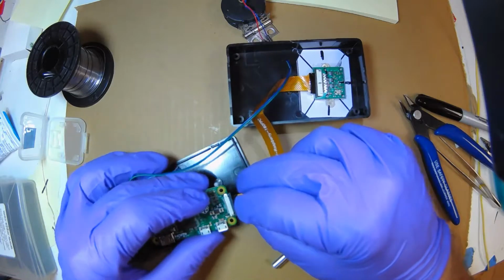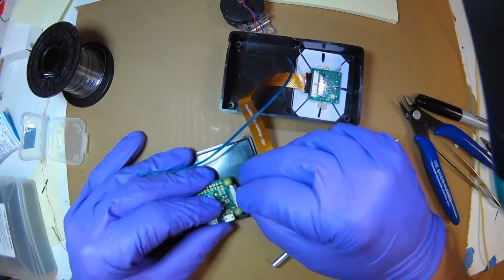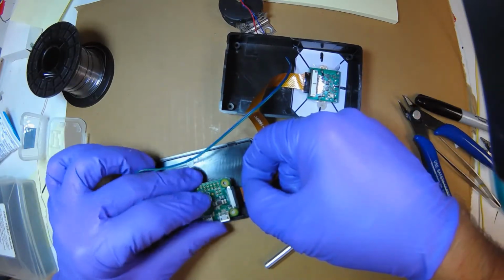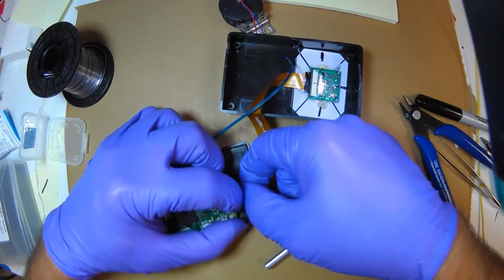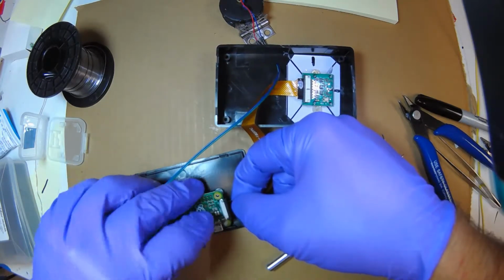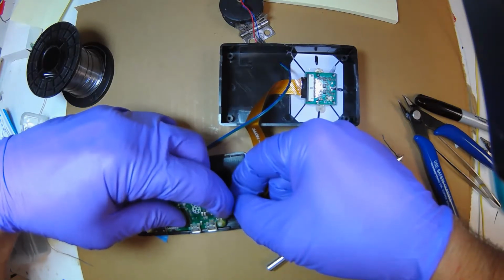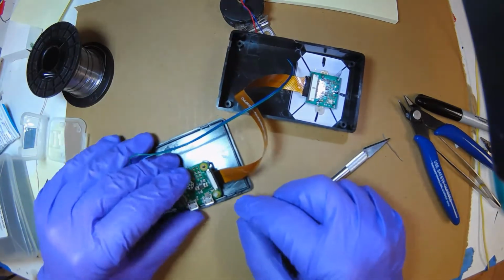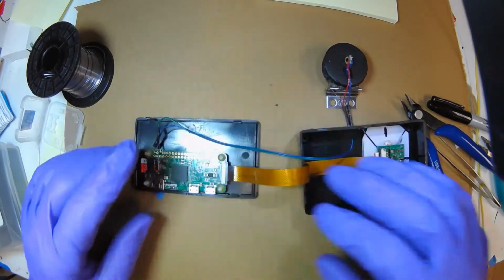So here's the tricky part. I'm going to anchor it back in these holes just so I have something to hold the circuit board. So I'm pushing it in with one hand, and I'm going to rub my finger along the top, evenly pushing in. So you're pressing the cable in with your right hand, and with your left nail, you're pushing that wedge back in. And you try and do it evenly, running to the right and left, right and left. Okay, so that was it. So now we can finally put this back, and we can put the screws on.